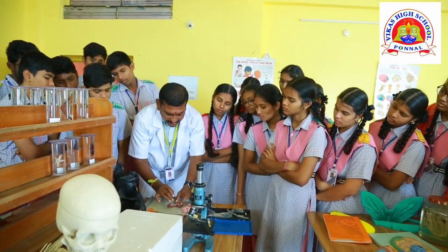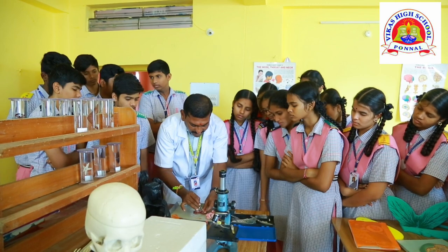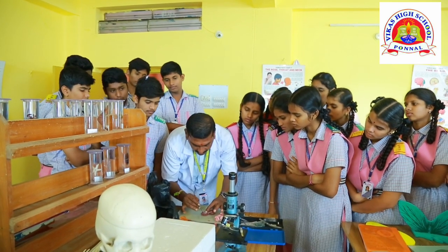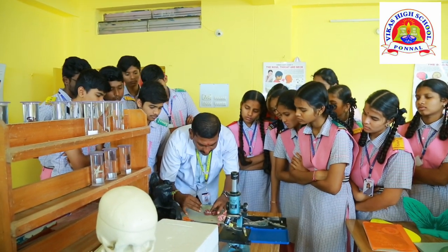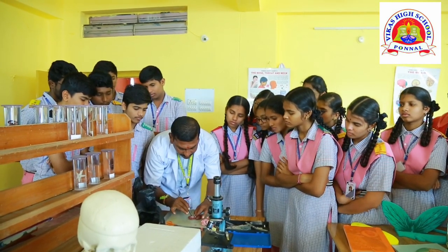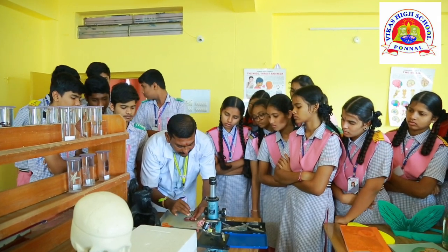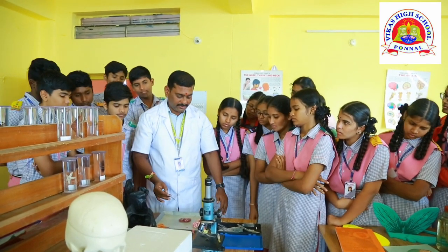So this is the LS, or what we call the internal structure. Inside it is very clear, you can see the calyces, how they are formed. They are just like pyramid-like structures here. Is it visible, children? So inside we have the calyces as well as the nephrons. Is it clear? Our kidneys are also present in the same manner, because we are mammals. So the kidney shape is the same. There is no difference in kidney shape here.